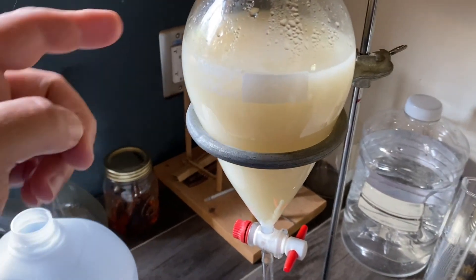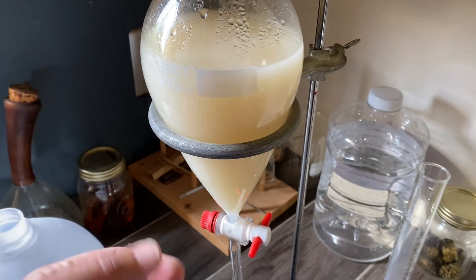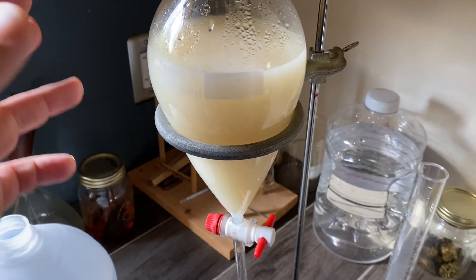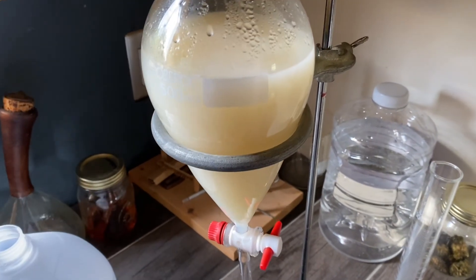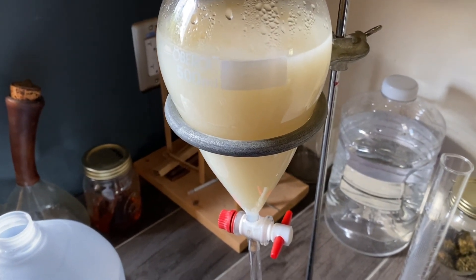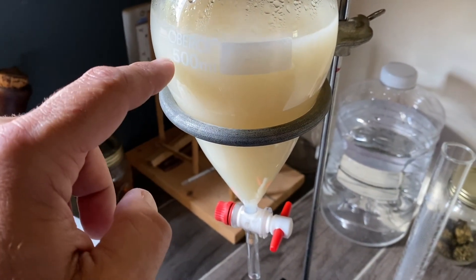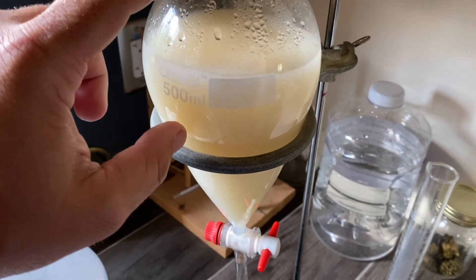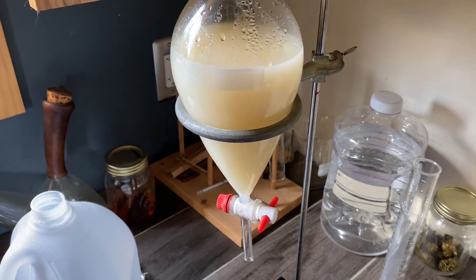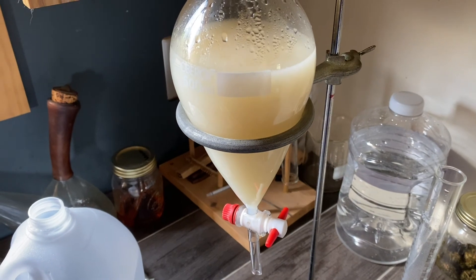Just for the record, I ended up adding 300 milliliters of distilled water back to it. I started off with 200 milliliters of chilled distilled water, so that would be 500 milliliters total plus the 160 milliliters of ethanol. This 500 milliliter mark is up to that line and the funnel has a little more capacity, but you basically just want enough water to get the job done.